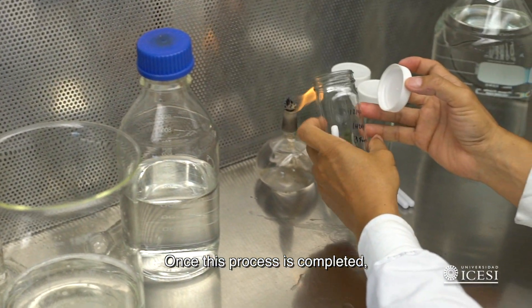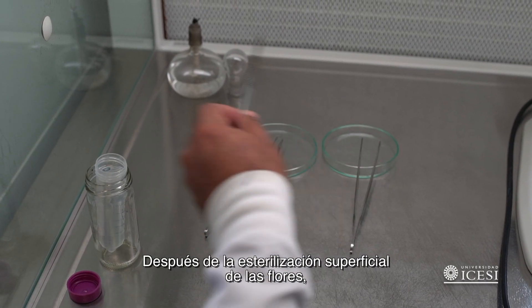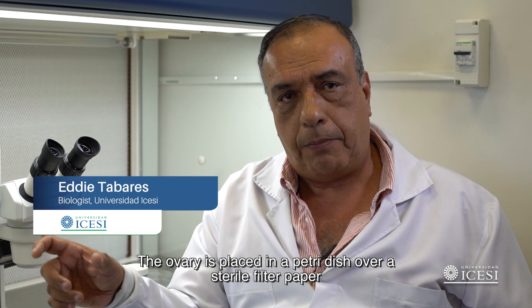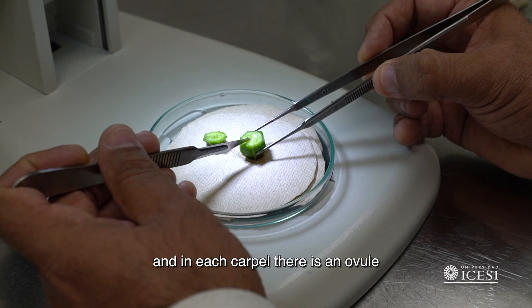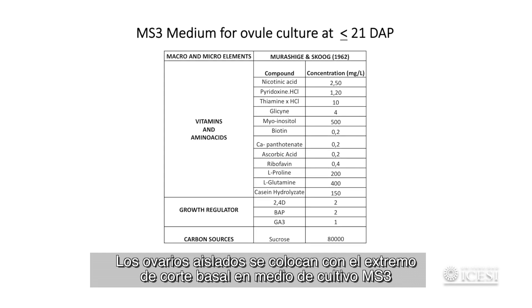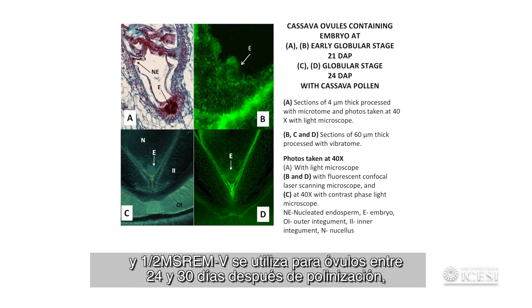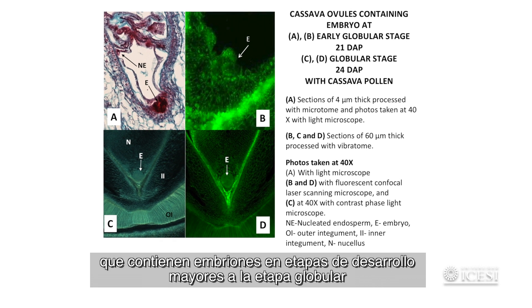After this process, we take the ethanol and leave it sealed to pass it to another cabinet. After surface sterilization, ovaries are cut longitudinally in 3 sections. Isolated ovary slices are placed with the basal cut end on medium MS3 or MS REMV, depending on the day after pollination. MS3 is optimal for ovules younger than 21 days after pollination, and half-strength MS REMV is used for ovules at 24 or 30 days after pollination, which contain embryos at developmental stages older than globular stage.